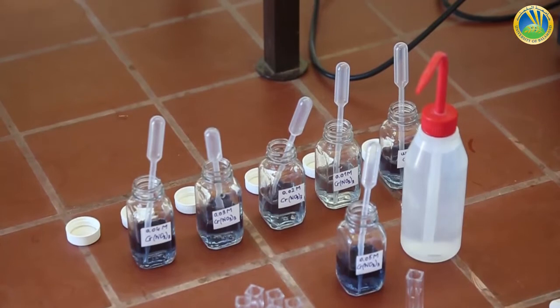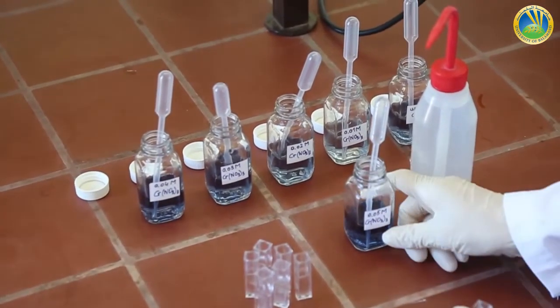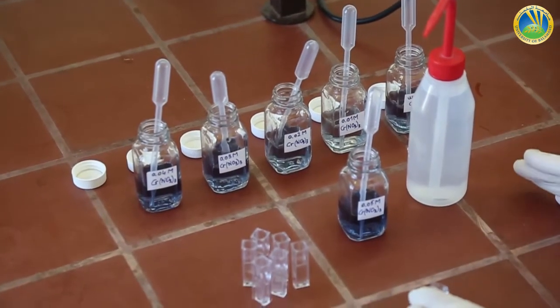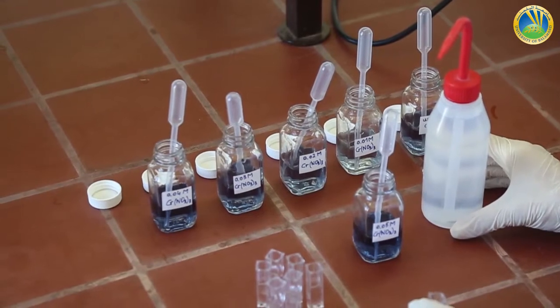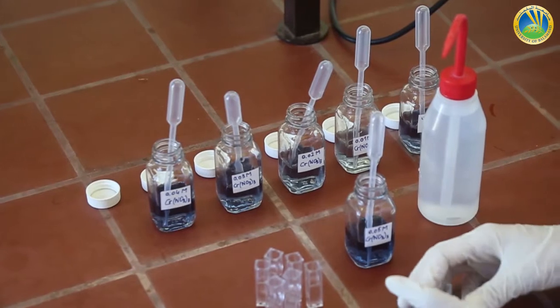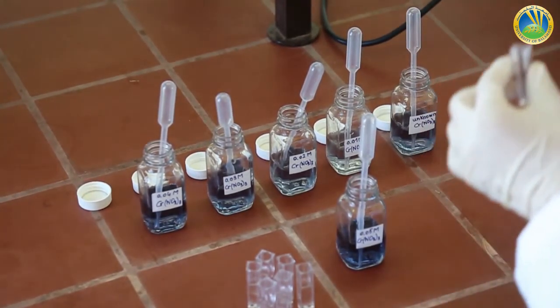Today we will be performing the fourth experiment of the course, entitled Spectrophotometry. In the first part of the experiment, we will be measuring the absorbance of a 0.05 molar chromium nitrate solution at different wavelengths between 350 and 600 nanometers at a 25 nanometer interval. The solution is prepared in distilled water, so our blank will be distilled water.